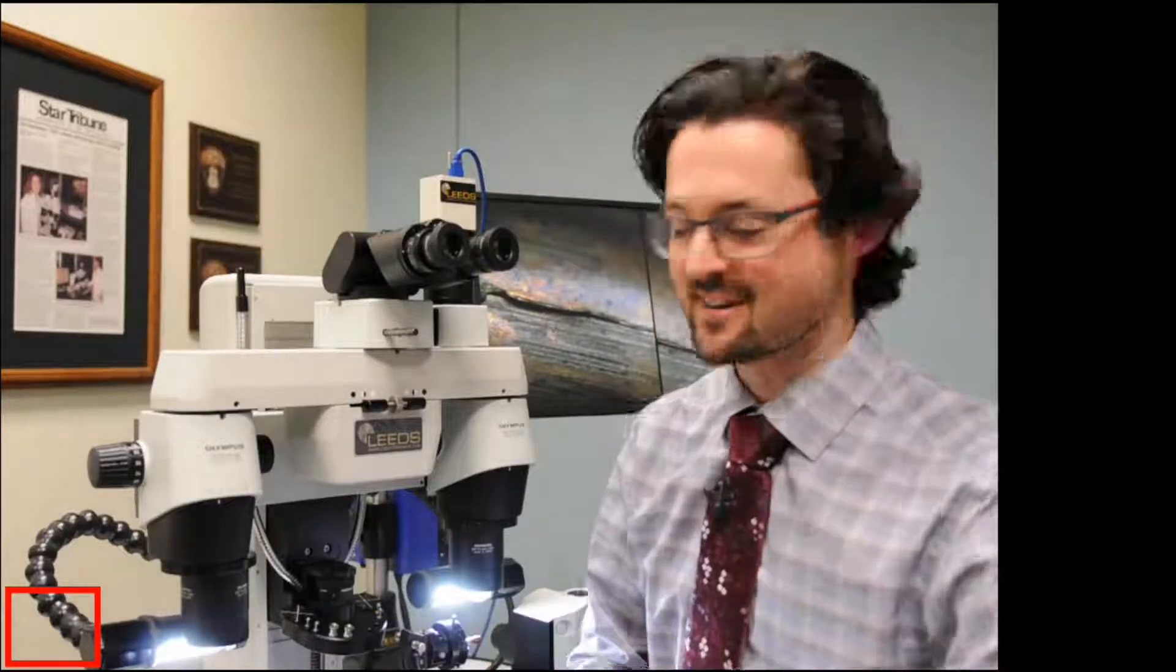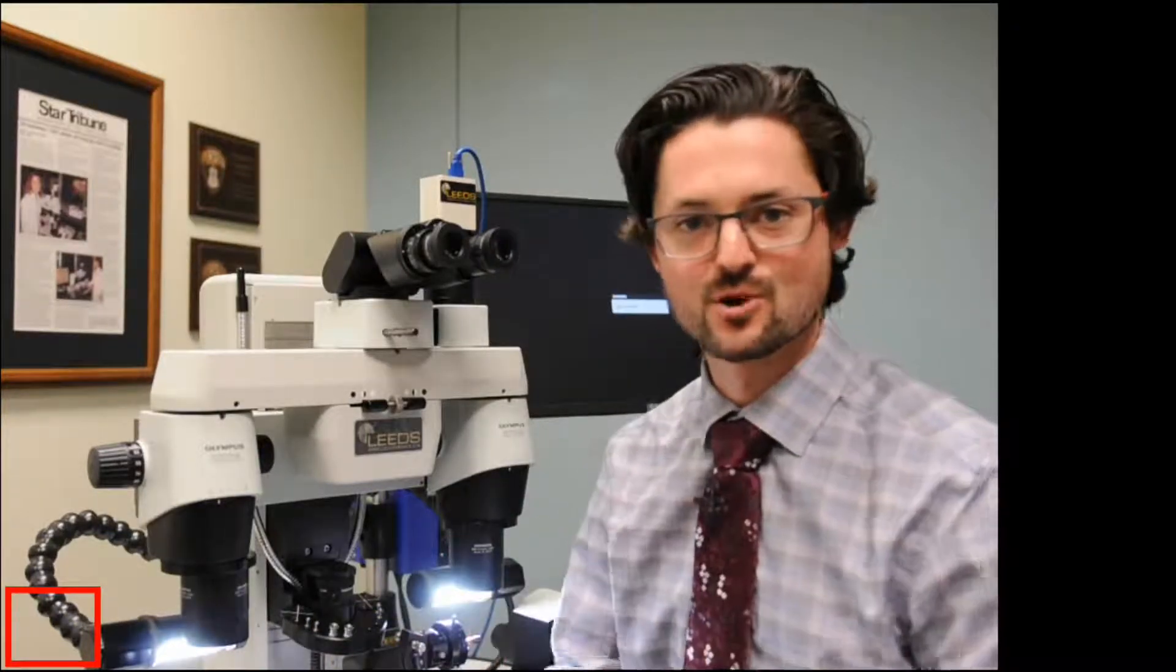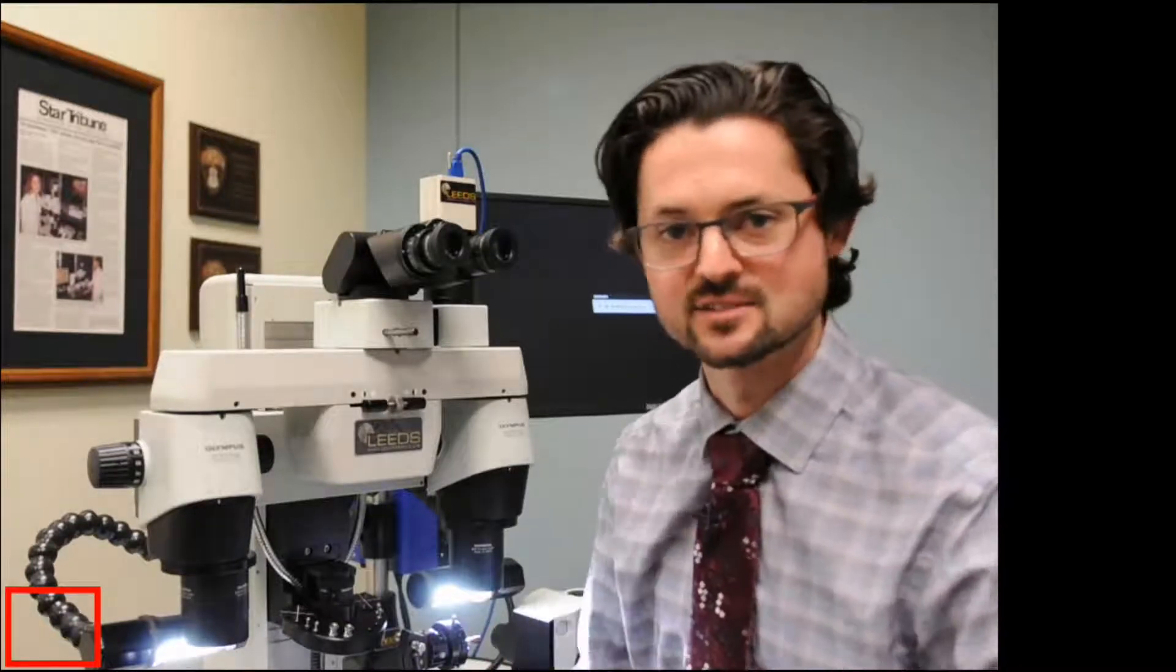That's the diopter technique. This was our helpful tip. I hope you guys find it helpful and useful as you're working in your casework. If you ever have questions, please feel free to contact us.